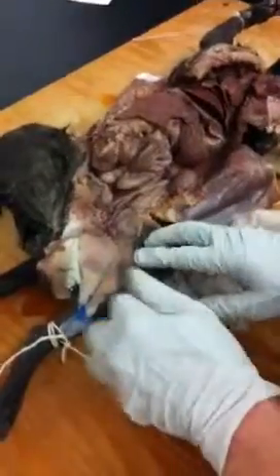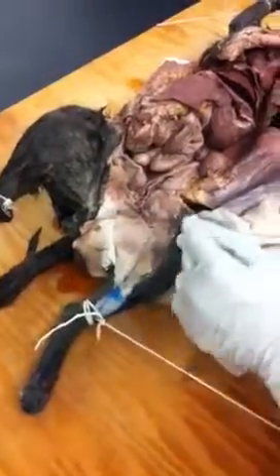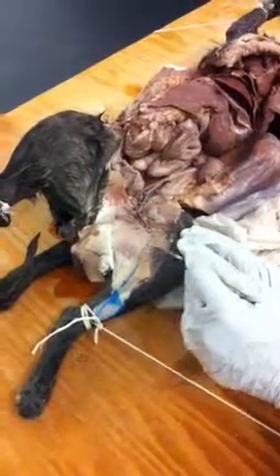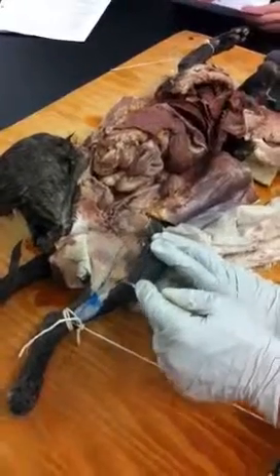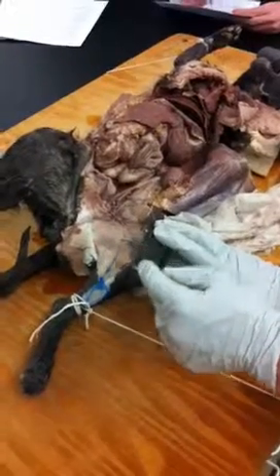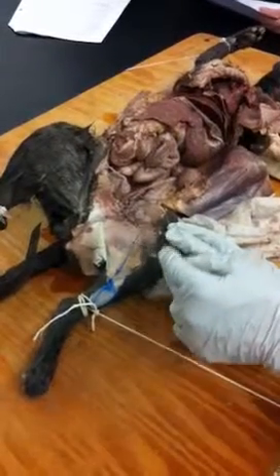So now if you were to follow this through, you could dig out all the arteries. They go deep in here, but we're only going to look at the veins. And so you'll see that as you go across the knee, there's a major branch that becomes superficial. Okay, this is the saphenous vein. Right here, it's medial. It becomes very superficial.